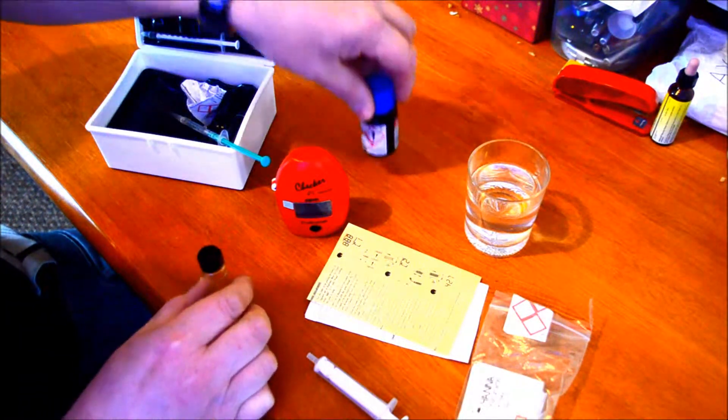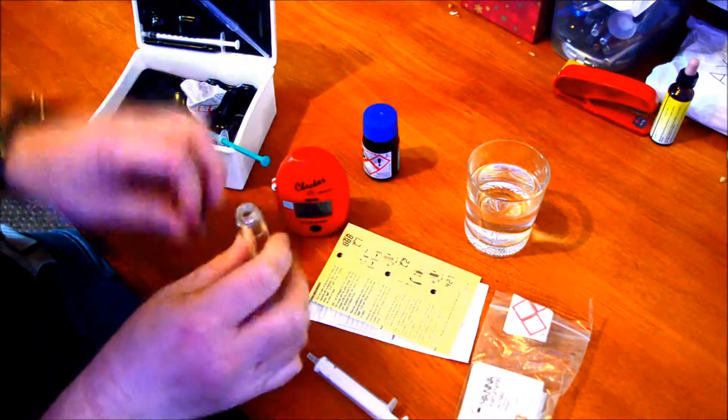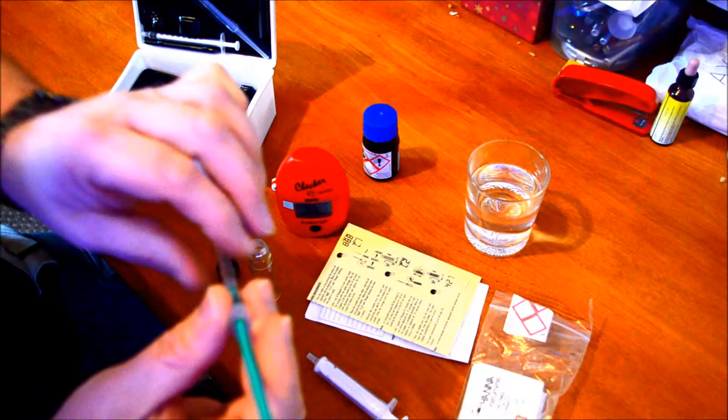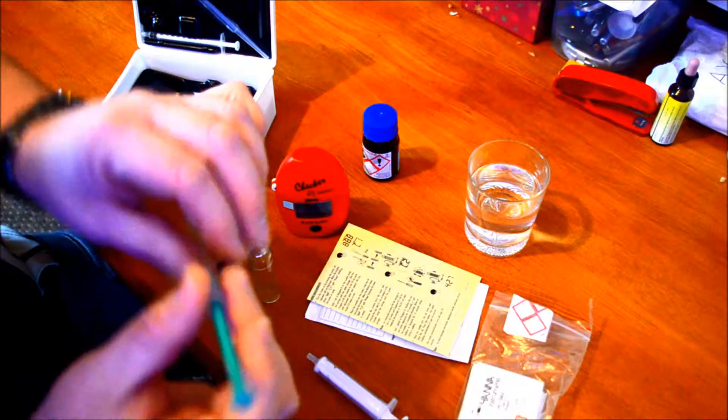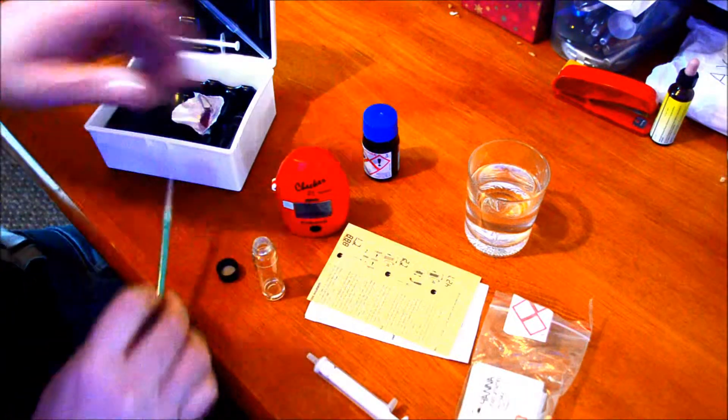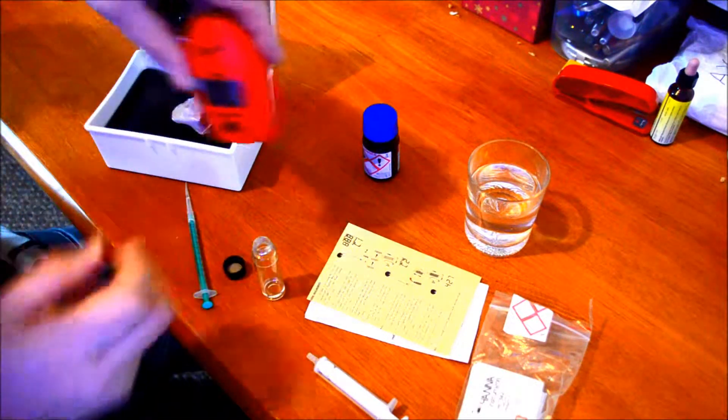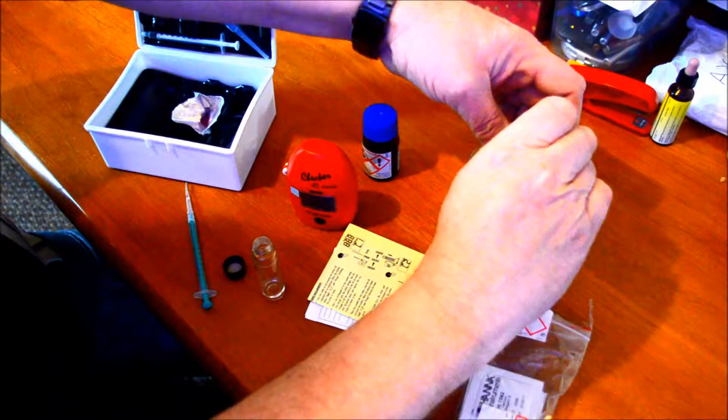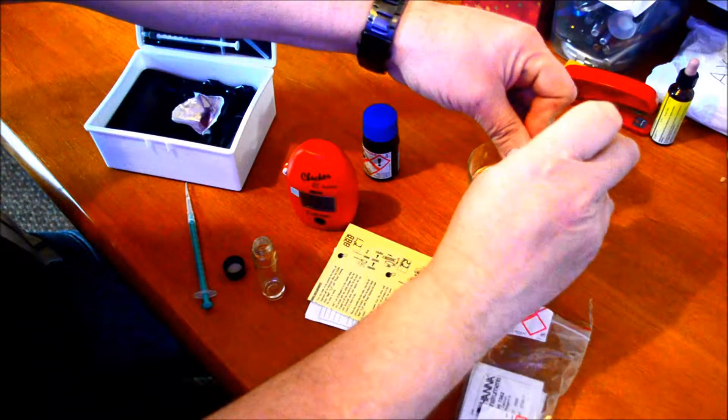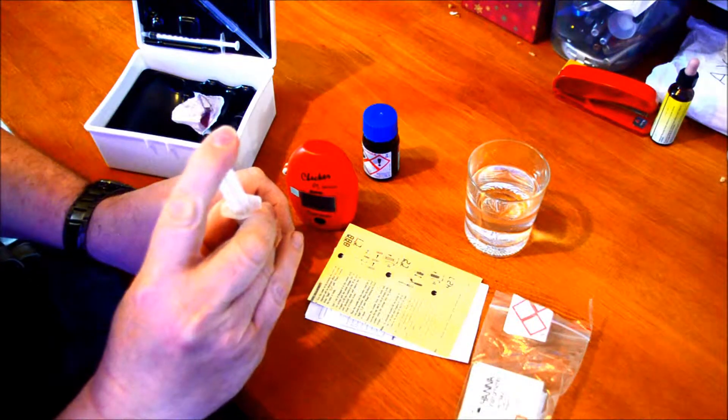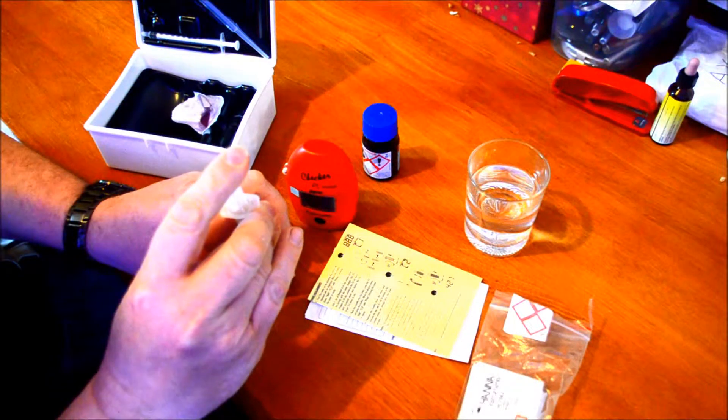I did that so I could switch it on. Then you get some water and fill it up to the 10 milliliter point.